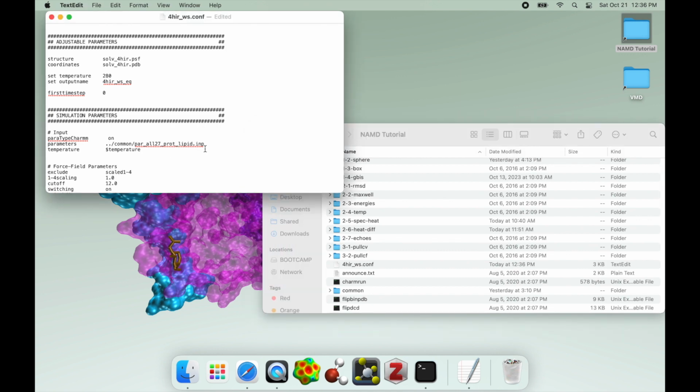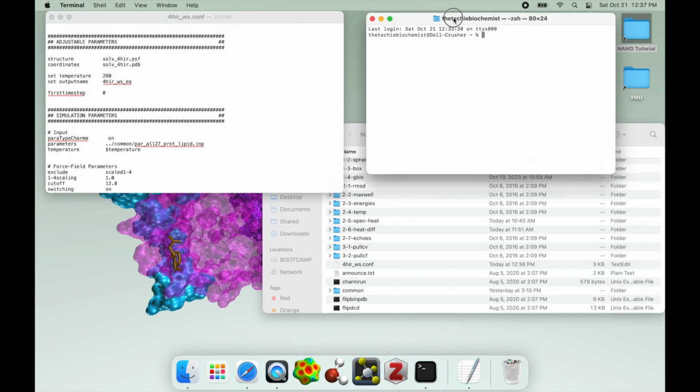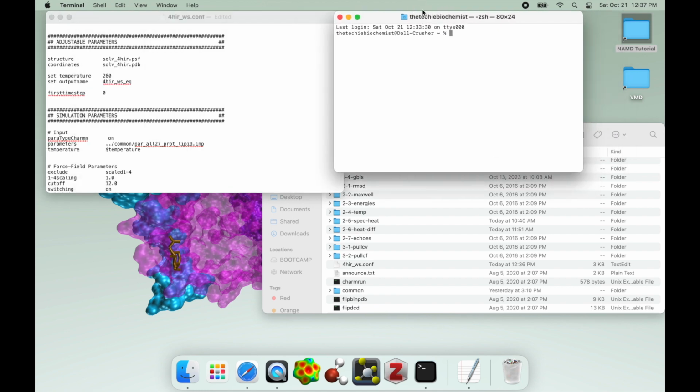You might be able to already identify what the problem is. This configuration file is in the NAMD tutorial folder. This first dot is telling it to look in the NAMD tutorial folder. That second dot is telling it to go up a level, which would be documents, and then look for a folder called common. Obviously, there's not going to be a folder called common in my documents level, so that is going to result in an error where my computer is going to tell me it can't find that parameter file. So let me demonstrate that real quick.